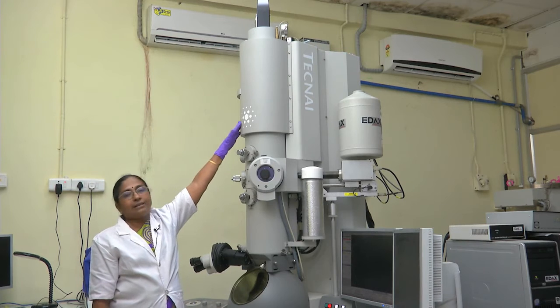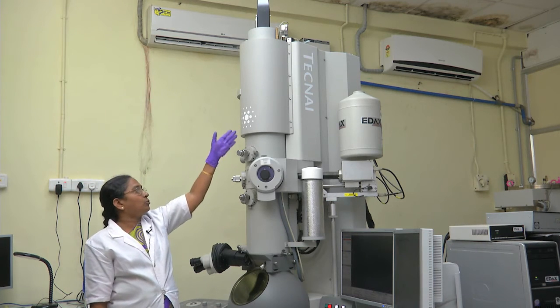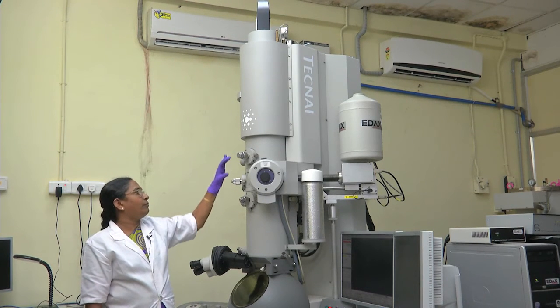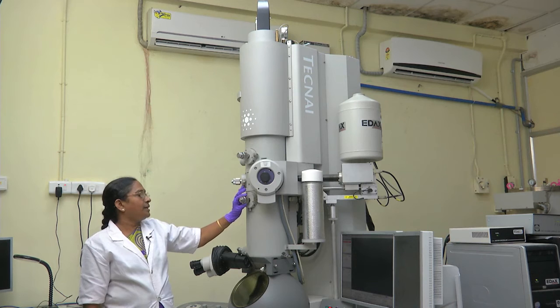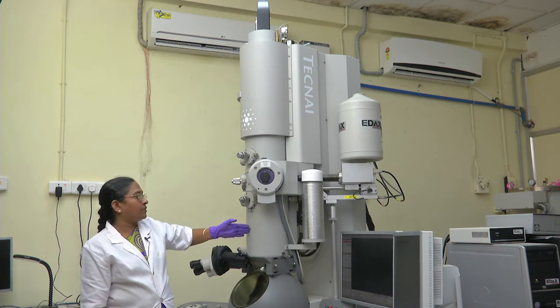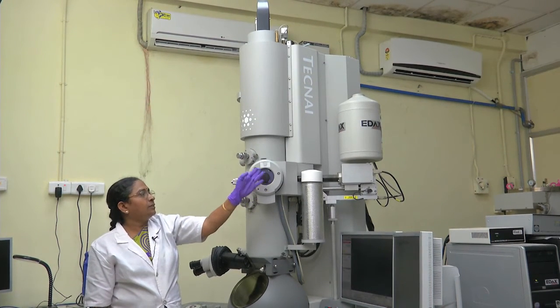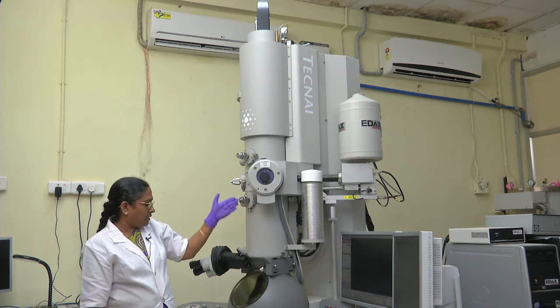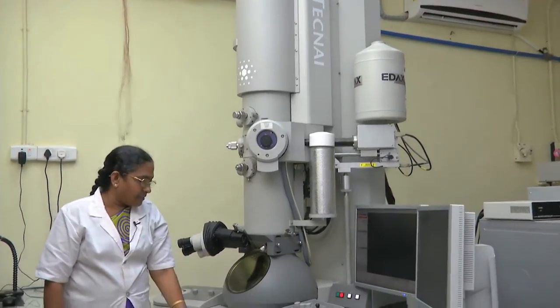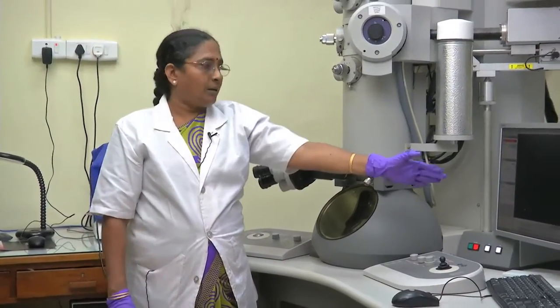There is an anode, and through that the electrons pass through different lenses — all electromagnetic lenses. The same type of condenser aperture, objective aperture, and selected area diffraction aperture are present, and the electron beam passes through these apertures. This portion is the specimen chamber; same single-tilt holder is loaded here. The electron beam passes through the specimen and you view it on the fluorescent screen. There is also a CCD camera — you capture the image and see it on the monitor.